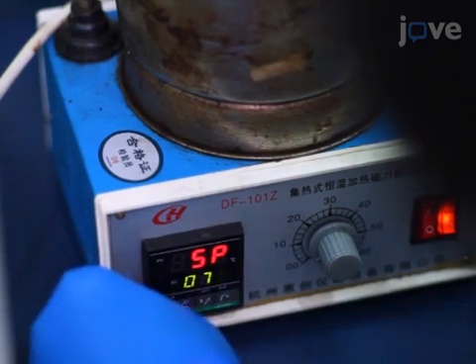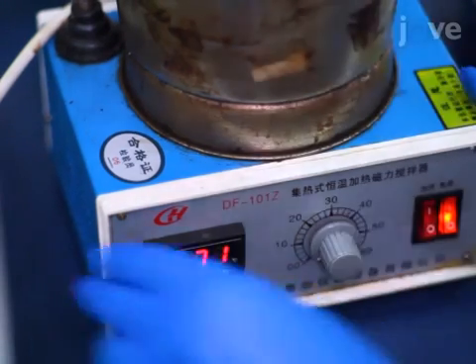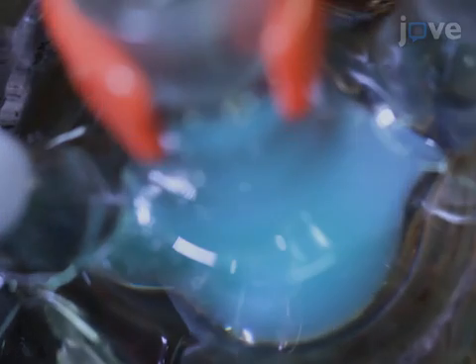Use a heating magnetic stirrer to heat the solution to 70 degrees Celsius while stirring at 50 RPM until the precipitate disappears.